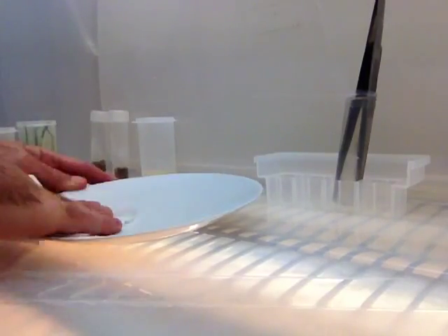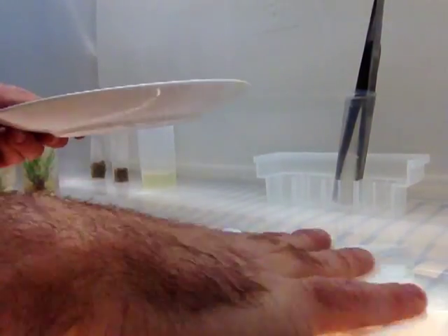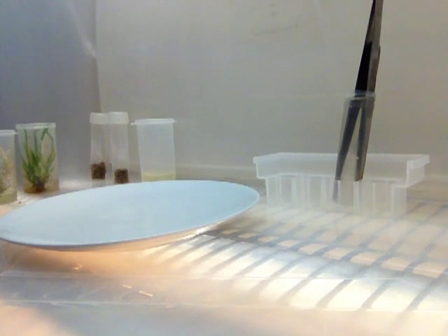I'm cleaning the plate. I've wiped down the hood. I'm going to wipe down the area underneath the plate and save the paper towel for when I'm done cutting up the plant.